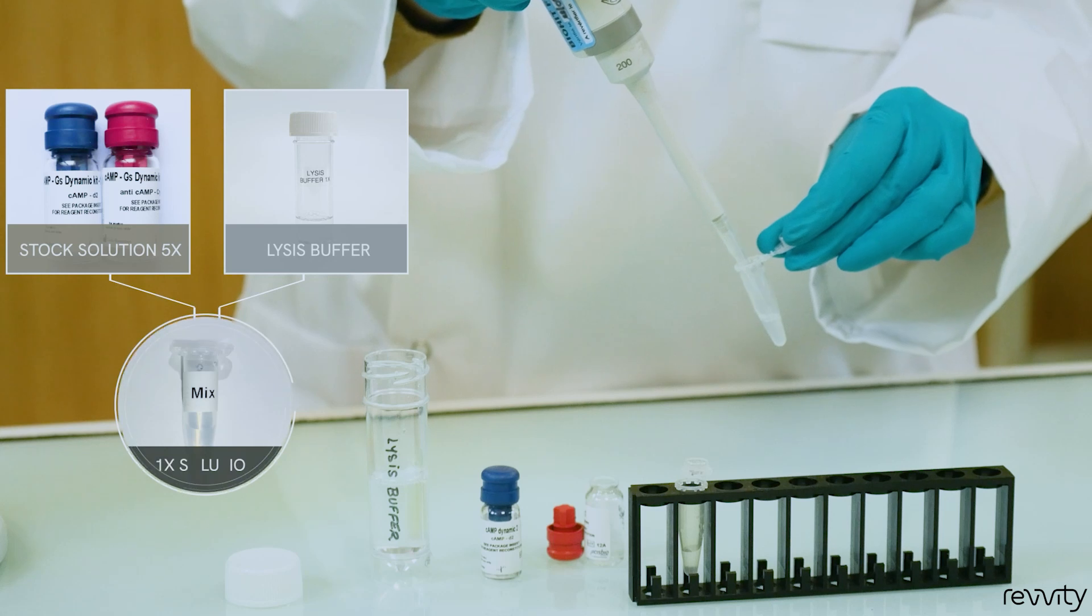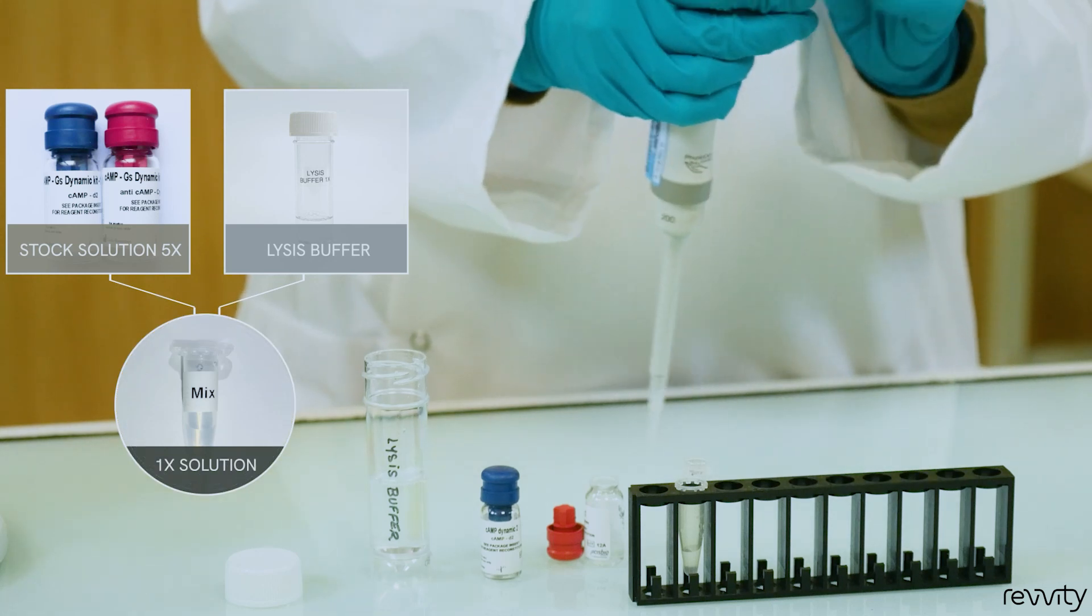To prepare working solutions, simply dilute your 5X stock solutions to 1X.